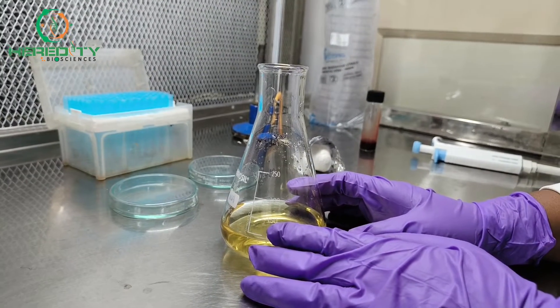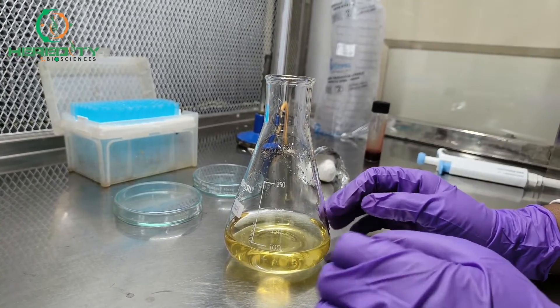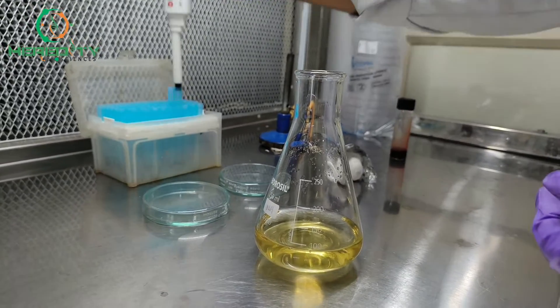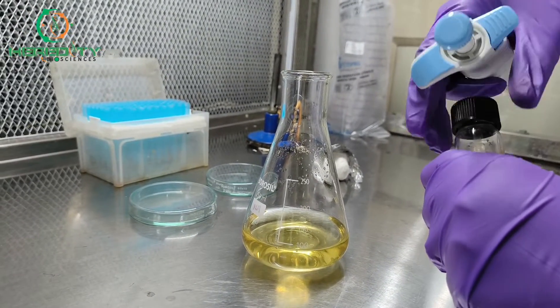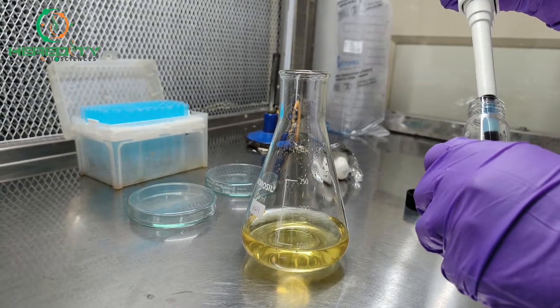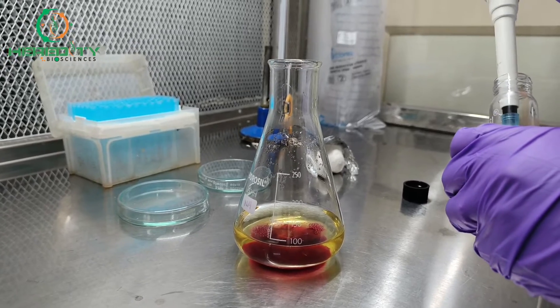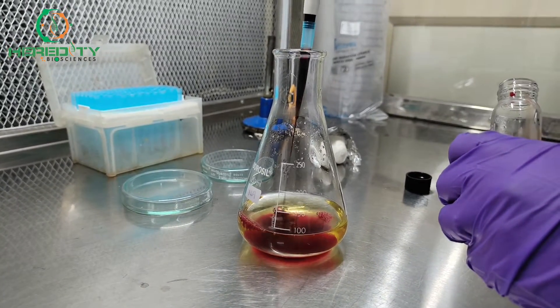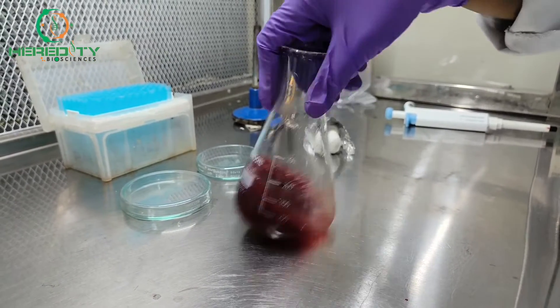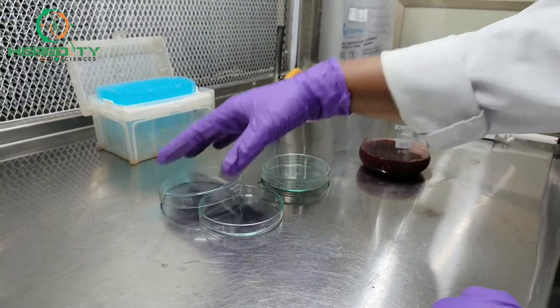Here we have prepared 100 ml of nutrient agar, so we take 5% blood. We will add 5 ml of blood to this 100 ml of nutrient agar. This is sterile mammalian blood. After the addition of blood, we will mix it.